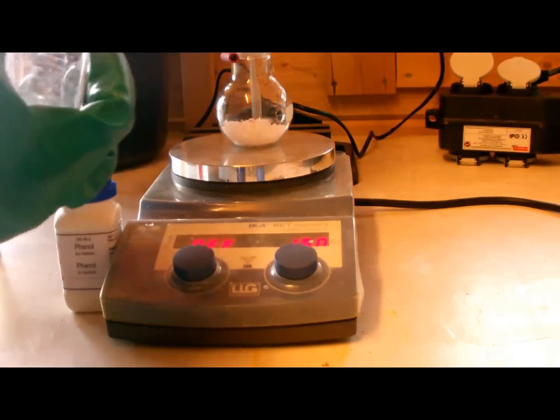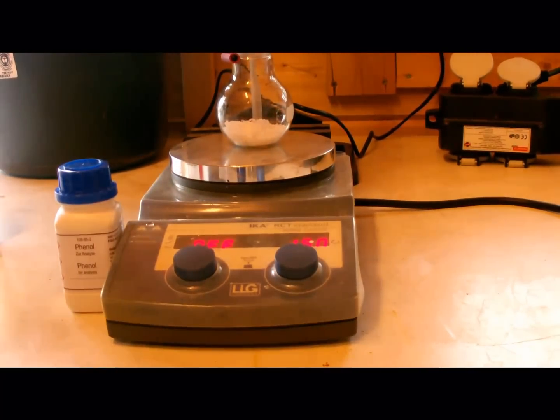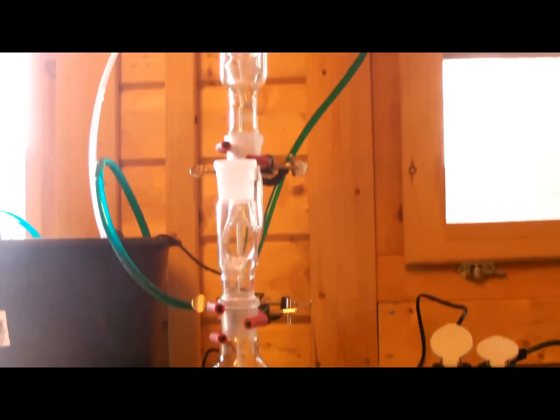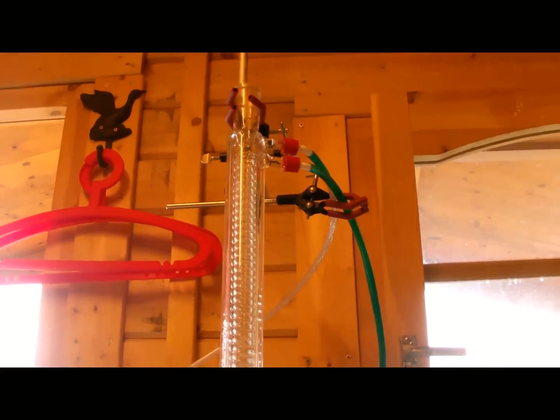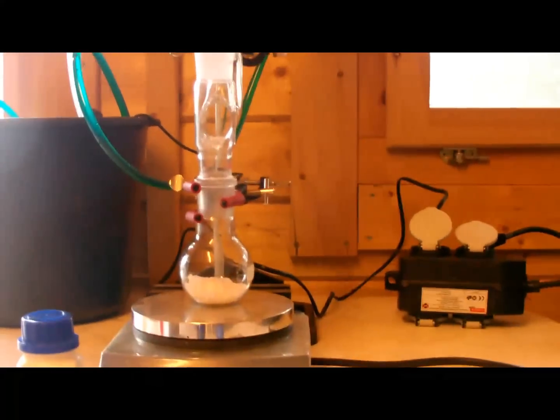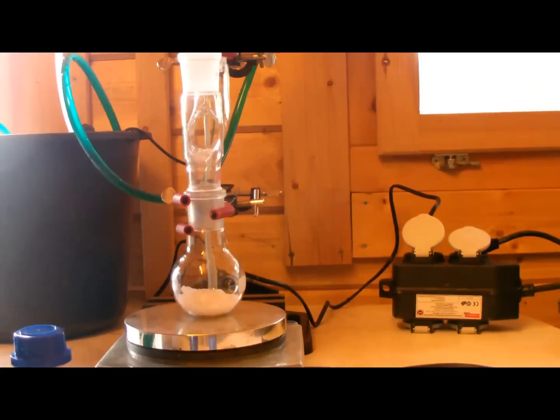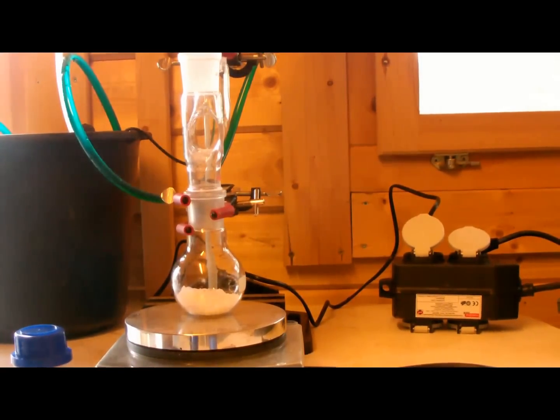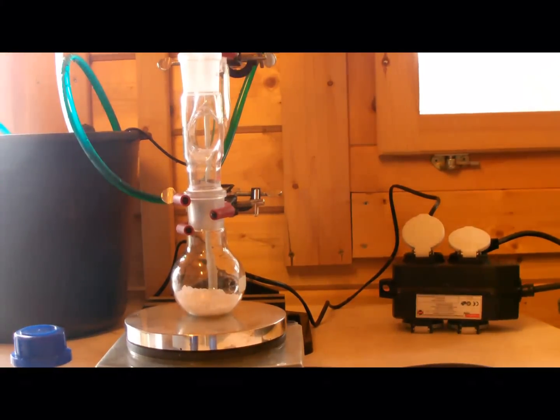First, in this kind of apparatus with a condenser to prevent vapors coming out, start with 4.7 grams of phenol and add to it 3.7 grams of phthalic anhydride. These are two equivalents of phenol and one equivalent of phthalic anhydride. You can scale up if you want more product. Then add 3 ml of concentrated 96% sulfuric acid. Turn on stirring and heating.